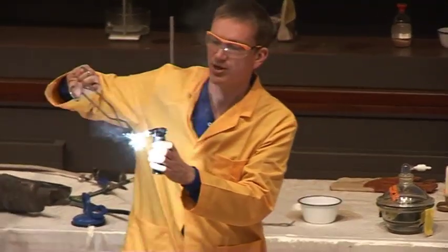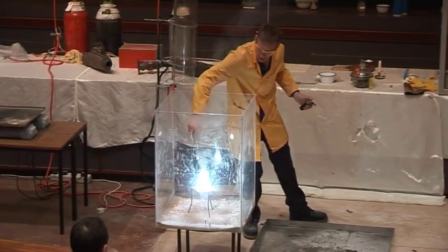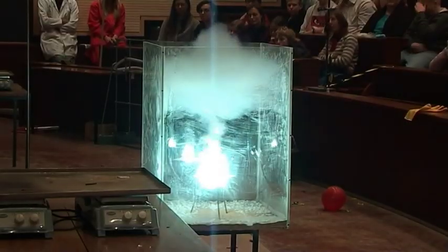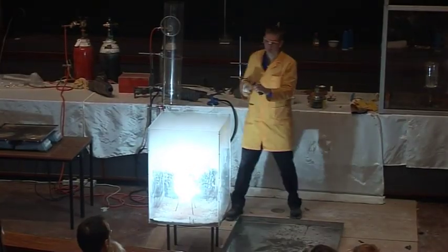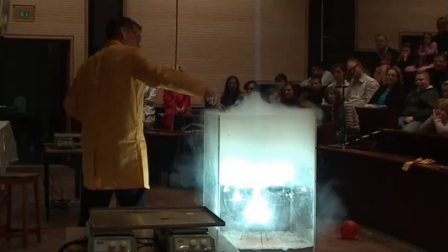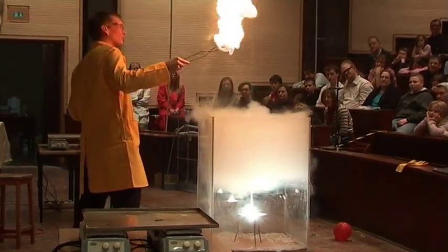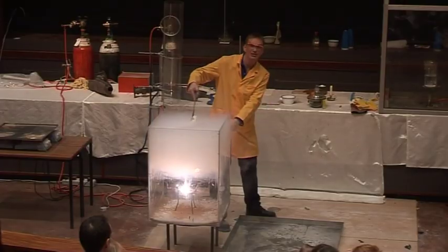So here the magnesium is burning. I lower it into the carbon dioxide, and actually it's burning even more vigorously than it did before. And if I put in the burning petrol, it's still put out, but I can't light my petrol on the magnesium. So the petrol will not burn in the carbon dioxide, but the magnesium will.